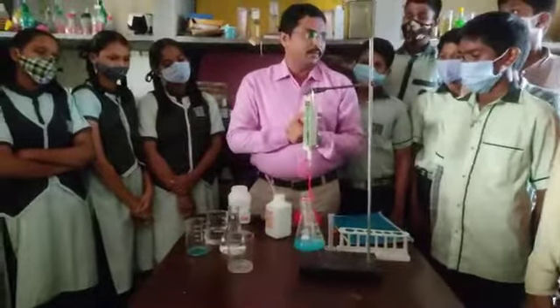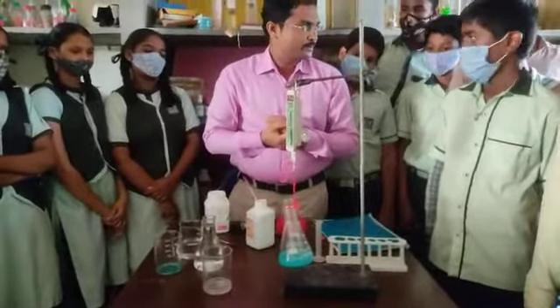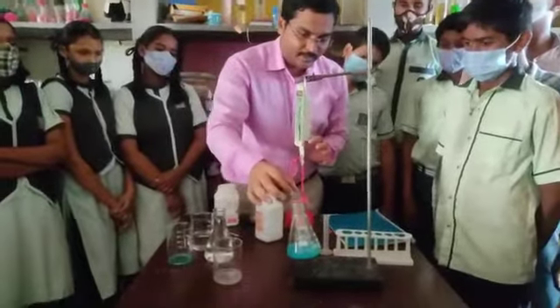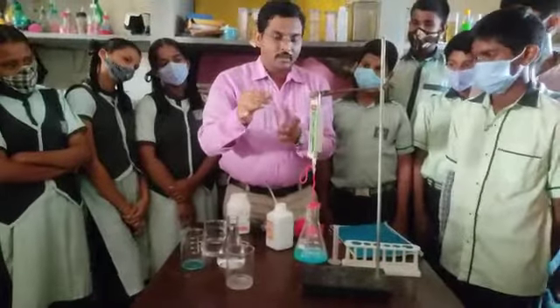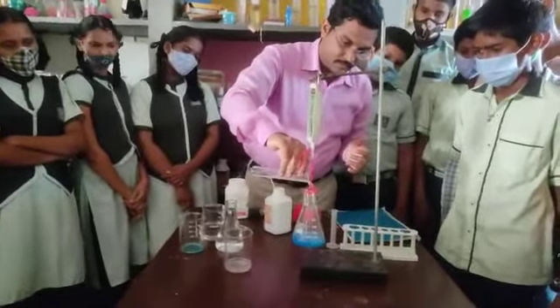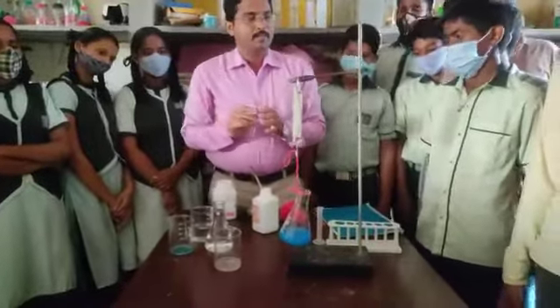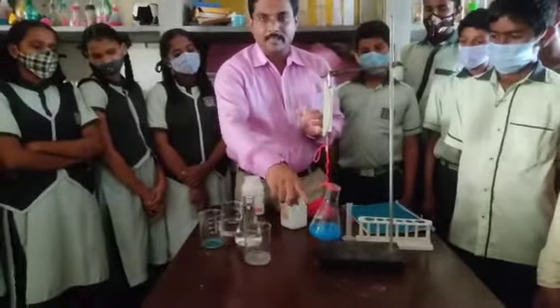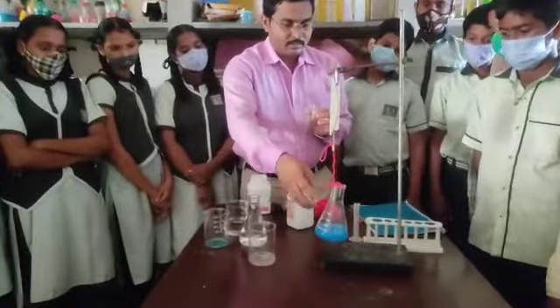So now we have the two reactants — sodium hydroxide in the test tube and copper sulphate in the conical flask. Before reaction, there is no mixing. Now, mix the sodium hydroxide with the copper sulphate. A reaction will take place between copper sulphate and sodium hydroxide, producing sodium sulphate and copper hydroxide. A blue colour precipitate will form. The product is now formed.